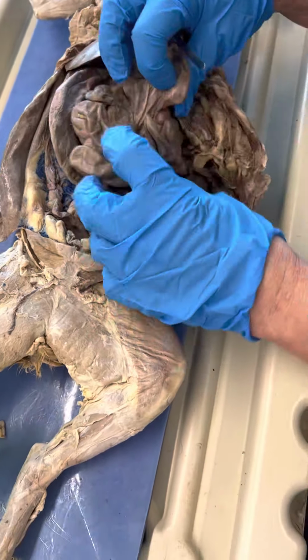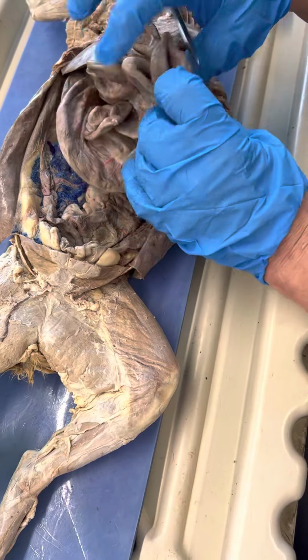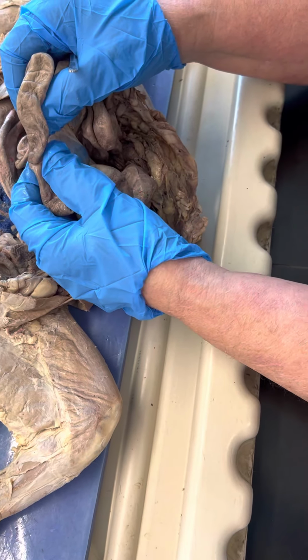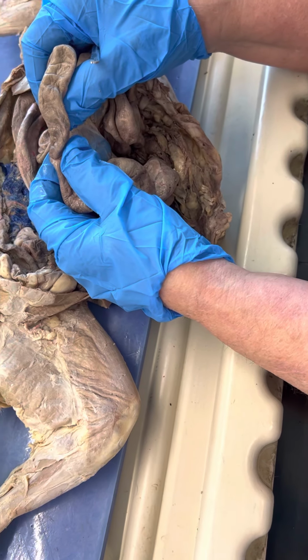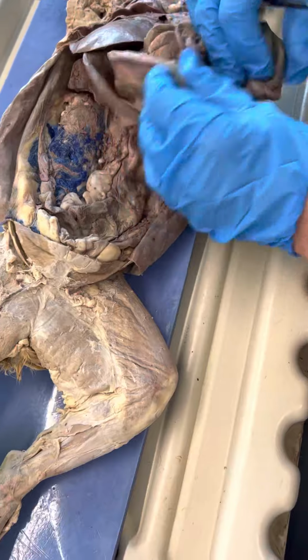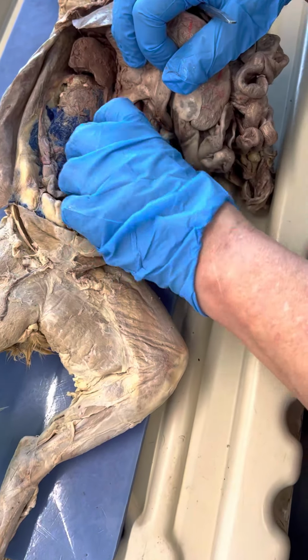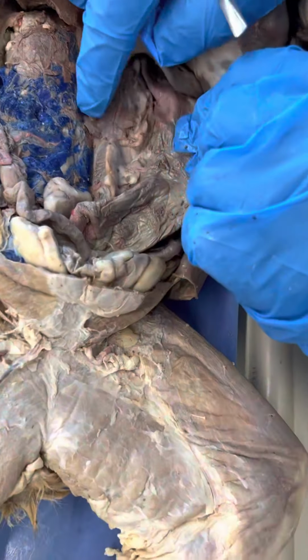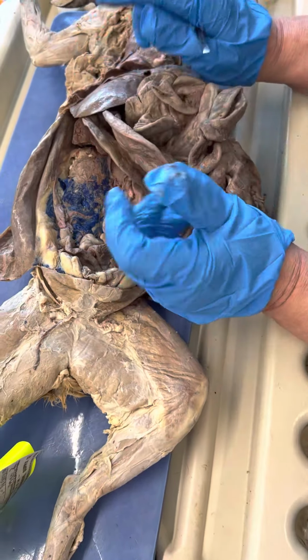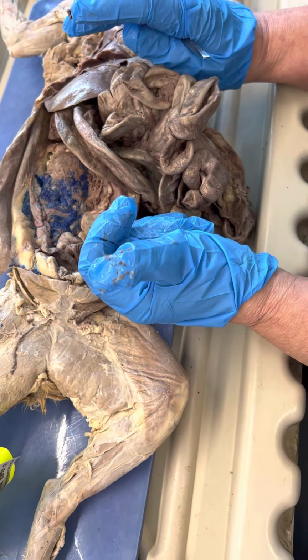Mesentery proper, usually, I haven't looked at your lab book, but usually that's the stuff that's between the loops of the intestine. Then you have your mesocolon. It's this piece that attaches the colon to the back wall. I'm not sure how far they're going to go with that.